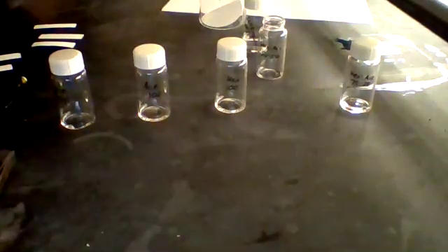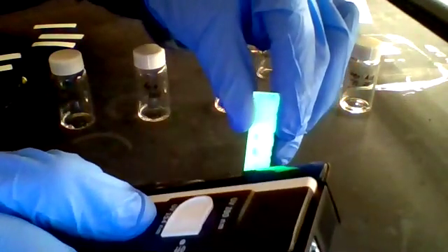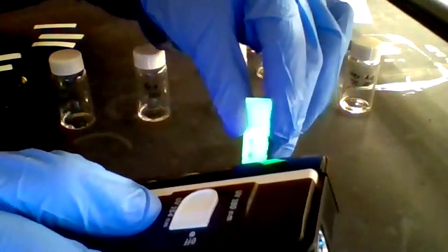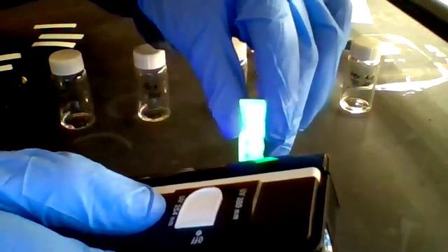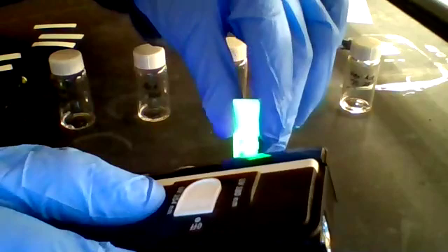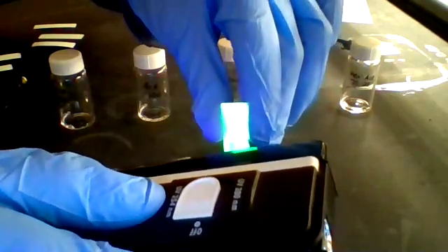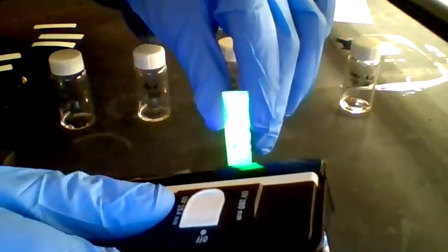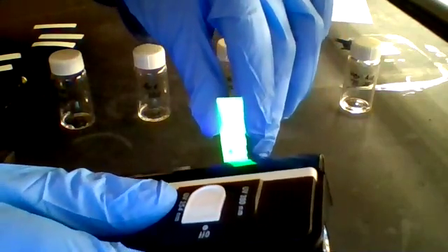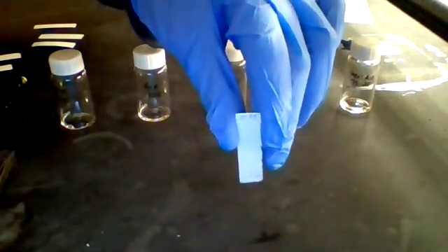Then what we would do is shine UV light on the TLC plate to illuminate it. And wherever there were compounds that traveled up the TLC plate at different spots, we would see a dark spot there. And that represents a compound that moved up a certain distance up the TLC plate. And so what we would do is we would circle these spots with pencil so that once we turn the UV light off, you could still see where the spots traveled.